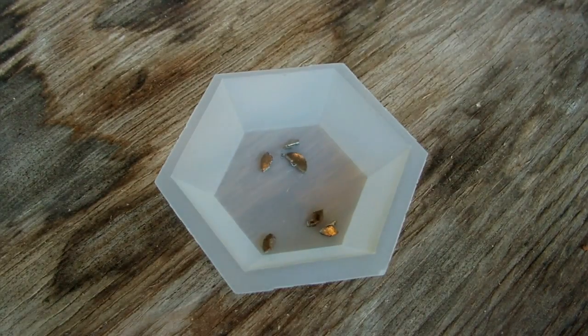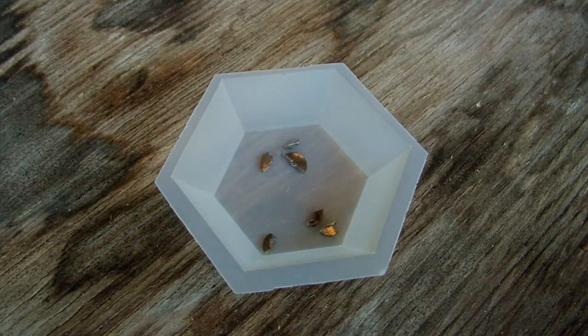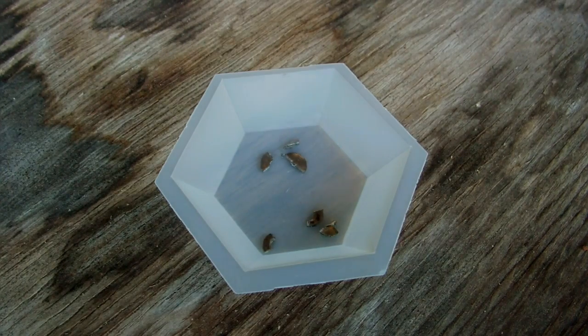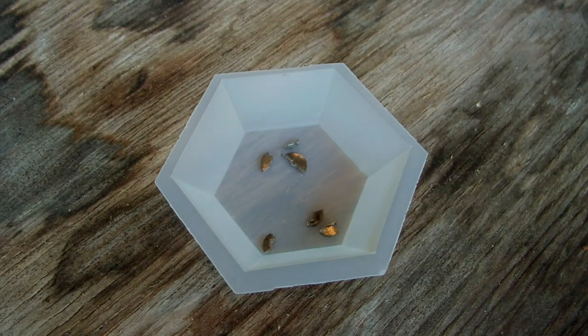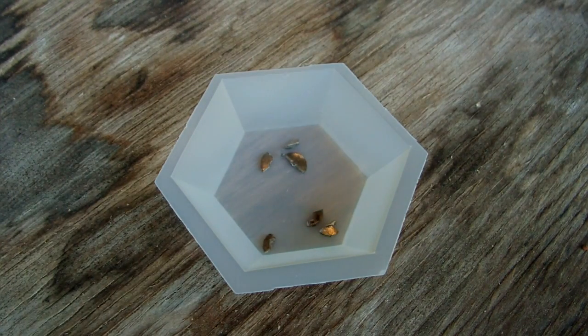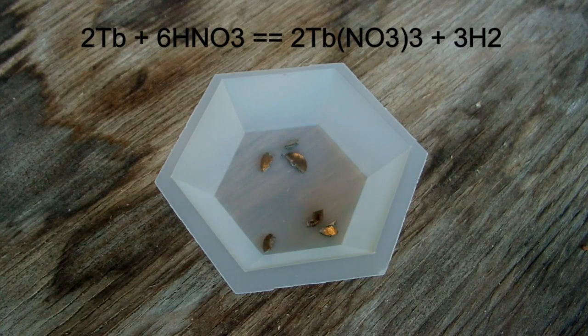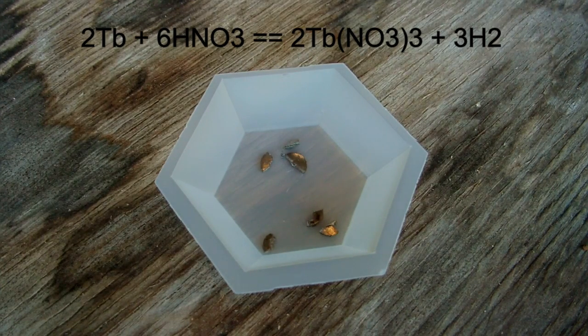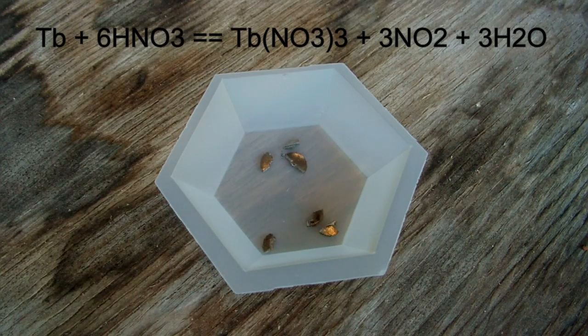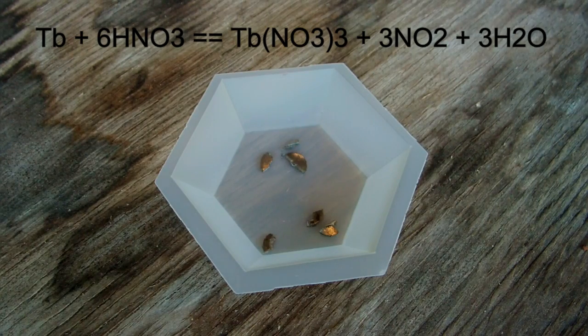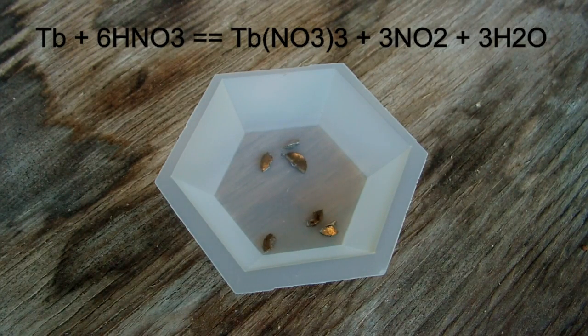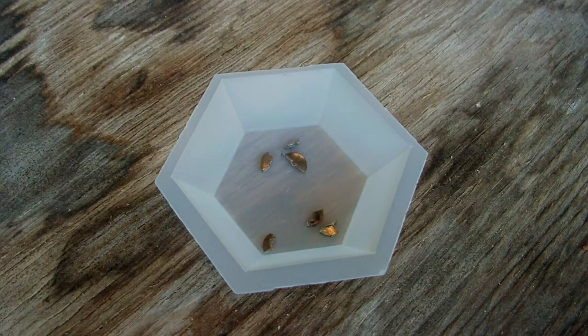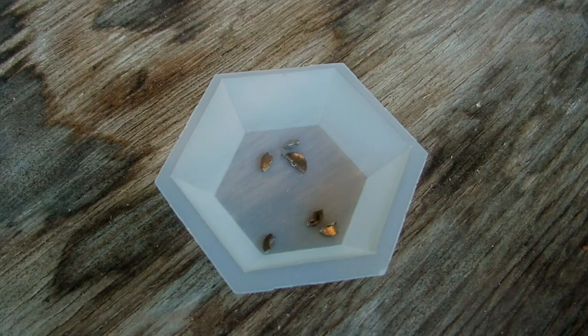Nitric acid can react in two different ways with metals. It can either react as a standard acid and simply produce hydrogen and the metal nitrate, or as we saw in my video where I made the nitric acid, it can react with metals like copper to form nitrogen dioxide. The potential reactions for terbium are: 2 moles of terbium plus 6 moles of nitric acid will yield 2 moles of terbium nitrate and 3 moles of hydrogen gas. The other potential reaction is 1 mole of terbium reacts with 6 of nitric acid to yield 1 mole of terbium nitrate, 3 moles of nitrogen dioxide, and 3 moles of water. These require different amounts of nitric acid to dissolve all of the terbium, so to know how much nitric acid I need, I need to determine which of these two reactions is actually going to happen. To do that, we're just going to add one small piece to nitric and see what it does.